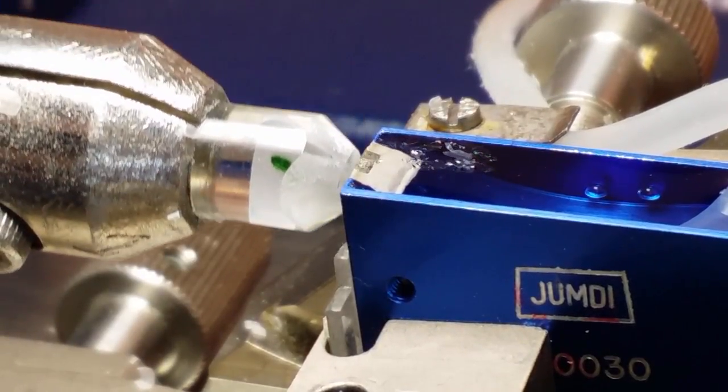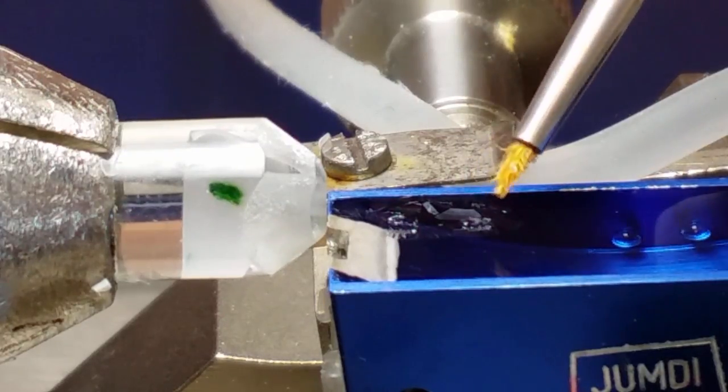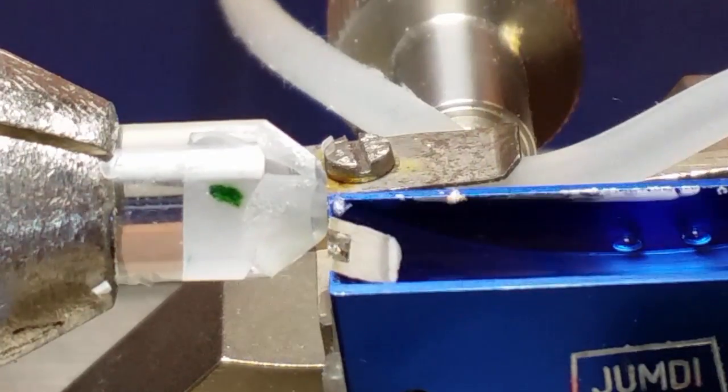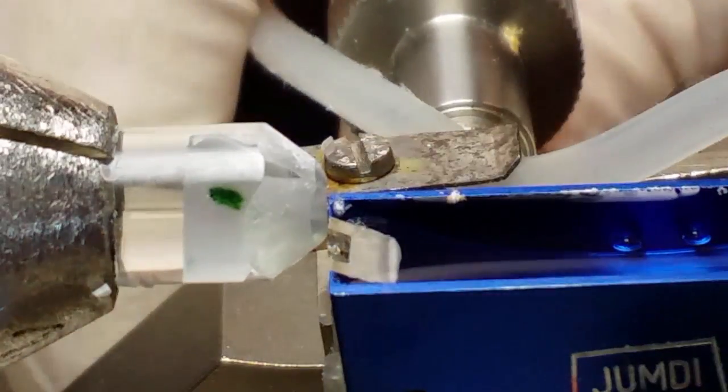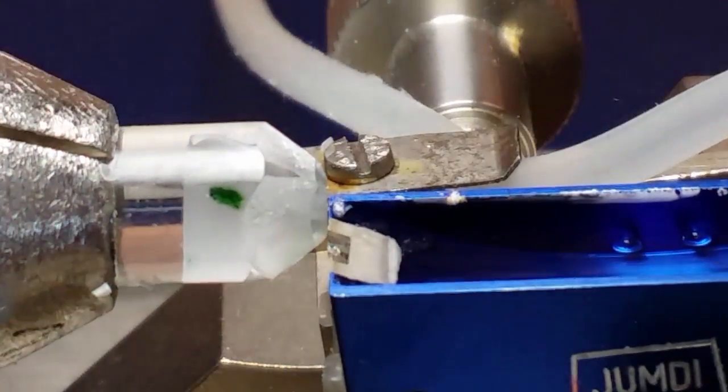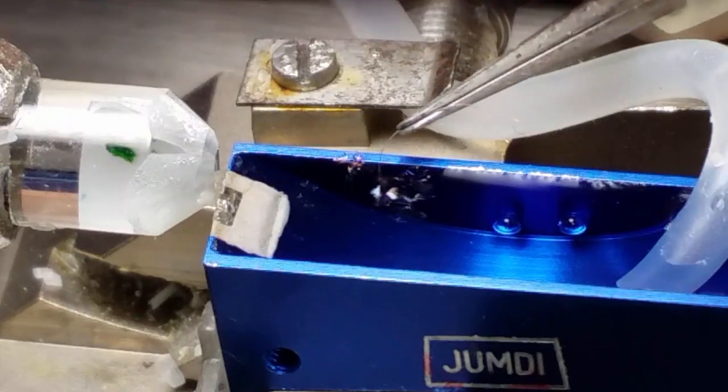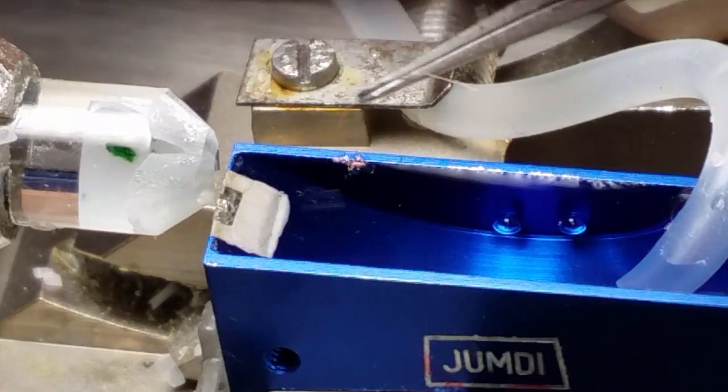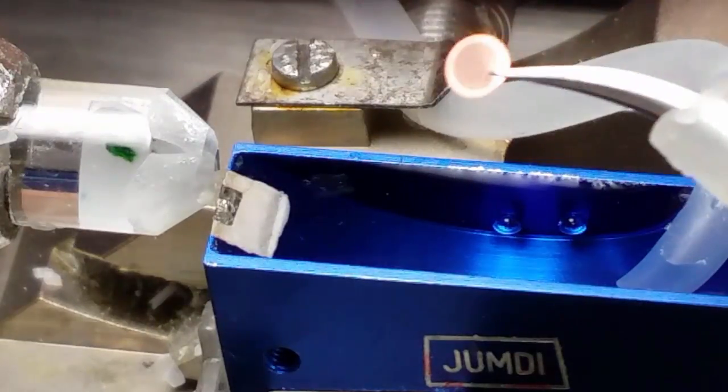Now we cut clean samples with the full size of the area that we want. I set the machine to cut up 120 nanometer slices. The old ones that are on the surface now we remove with the brush. Here comes the slices now. The speed you cut with depends on the sample. Some samples need higher speed, some samples need lower speed. I think I have one that I am going to try now. So first I remove most of the rubbish. Use the eyelash to select out the piece you want. I do this work by continuously looking in the binoculars.